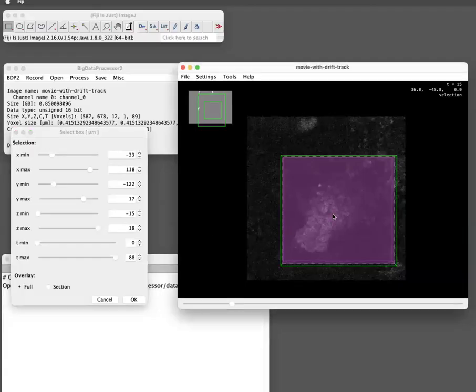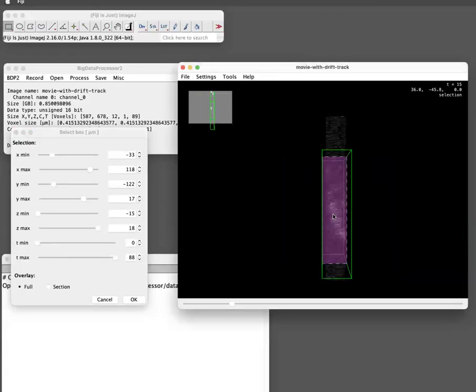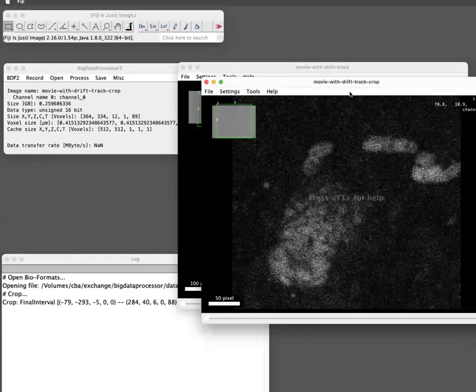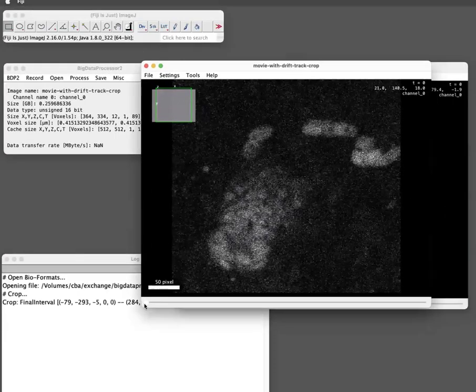To check that, you can press Shift X to look from the side. Okay, I mean, this looks reasonable. This is a bit tricky. Shift Z, you're getting back into the XY view. So I just take everything in Z and I'm sure I'm not losing anything. Okay, so that looks excellent. So I click OK. So now we have the tracked cropped movie.